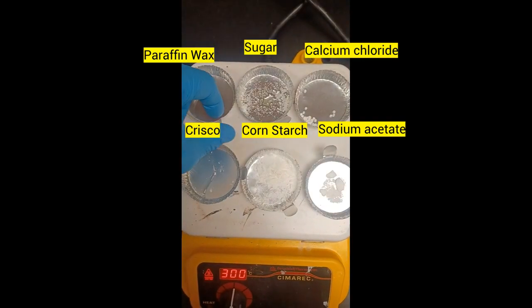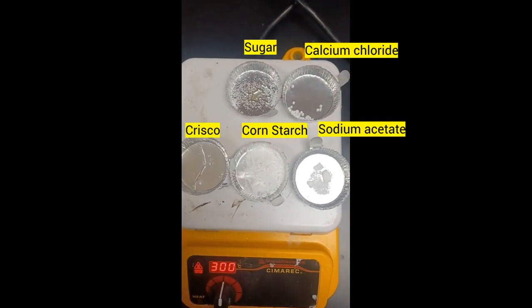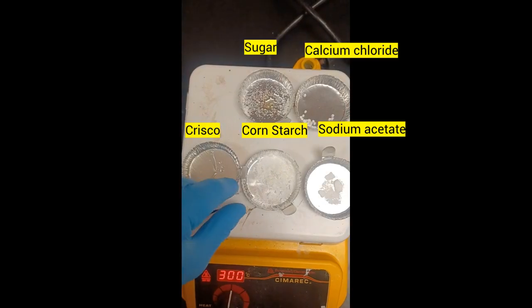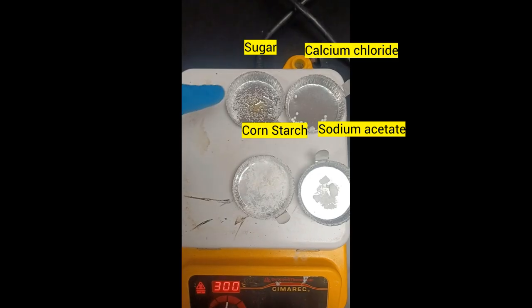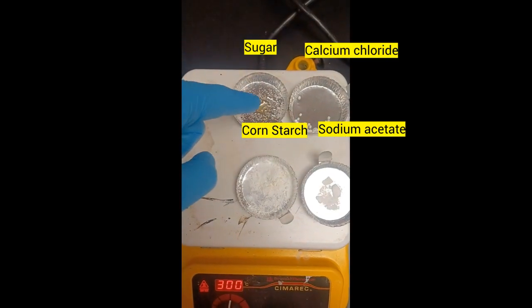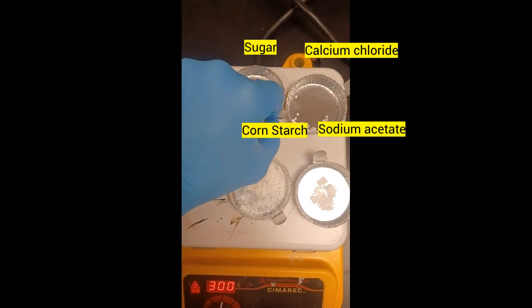I'm just going to take this off. We can successfully say that paraffin wax does indeed melt very easily. Same thing with the Crisco. The Crisco is very obviously melted here. Next, in the back, you can see this sugar is starting to melt. You can actually see it's starting to caramelize here in the center. I'm going to take the sugar off before it burns. It has indeed melted.